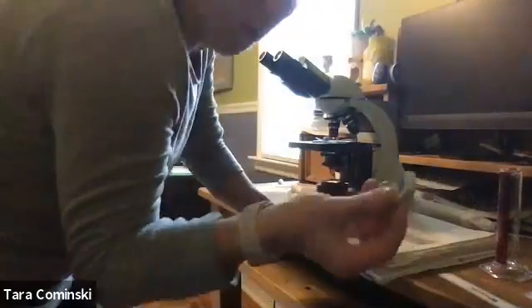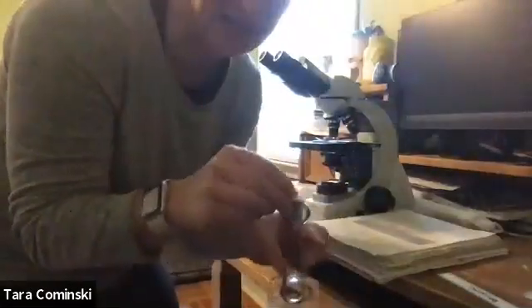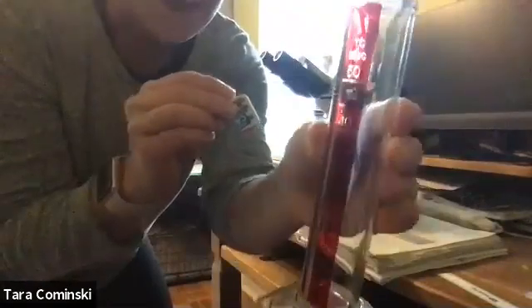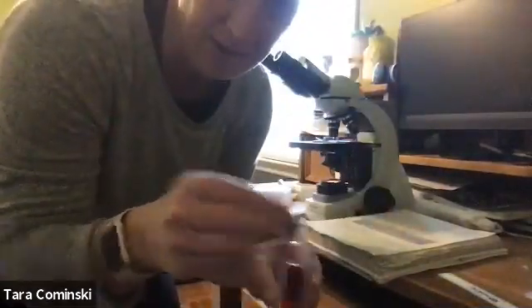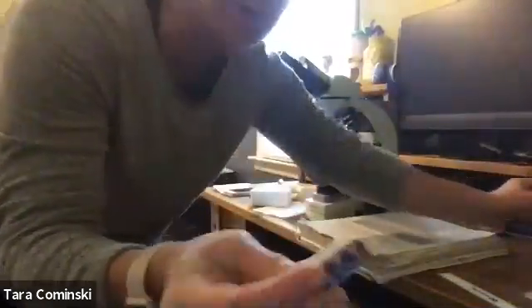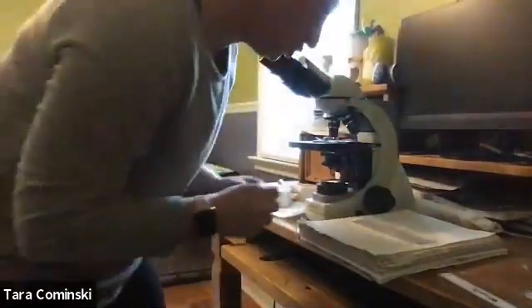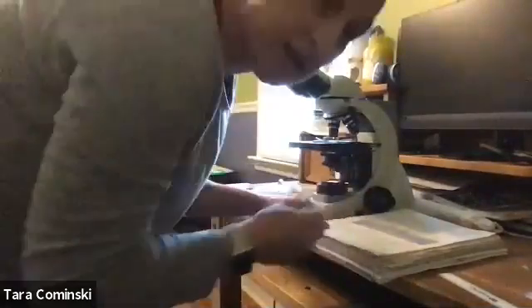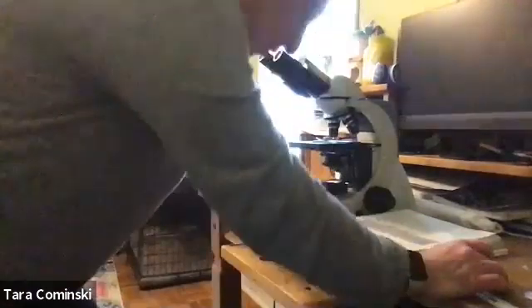So we're gonna get a wooden block that's small enough to fit into a graduated cylinder because it's gonna set us up for the next part. So here's my graduated cylinder, okay? And I had to cut an eraser that would fit inside, okay? So that's our object. We would weigh it. I'll tell you that it weighs 2.8 grams, okay? 2.8 grams, you're gonna write that in for number 2 under experimental procedure for weight. Right? And then you're going to figure out how many milligrams.